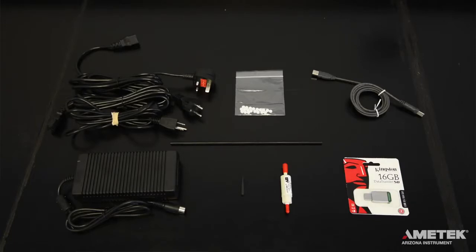Components of the accessory kit for the J405 depend on the instrument model. For all models, you will receive a three-foot line cord that meets the requirements of the country in which the instrument will be used, an AC power adapter, one pack of 20 fritware filters, a probe, a quarter inch to one-eighth inch tubing adapter, and a zero air filter.